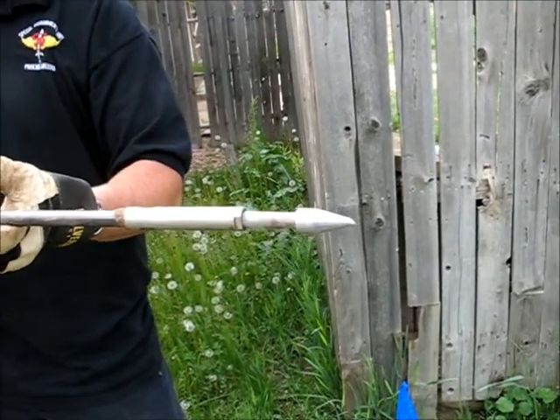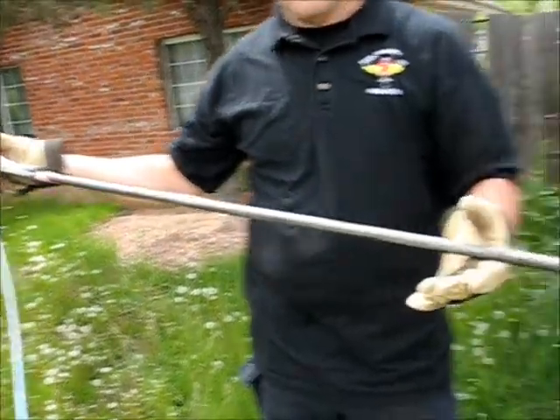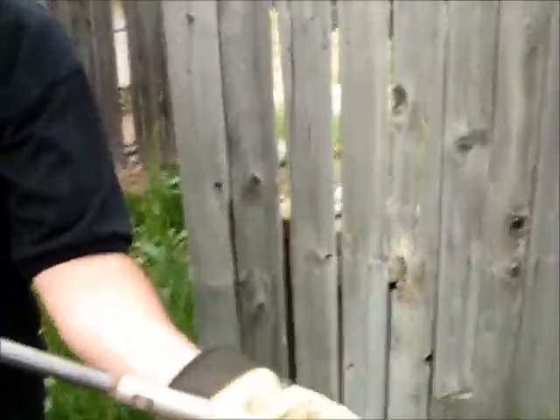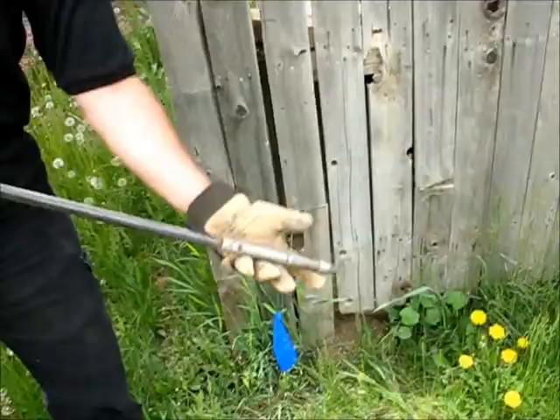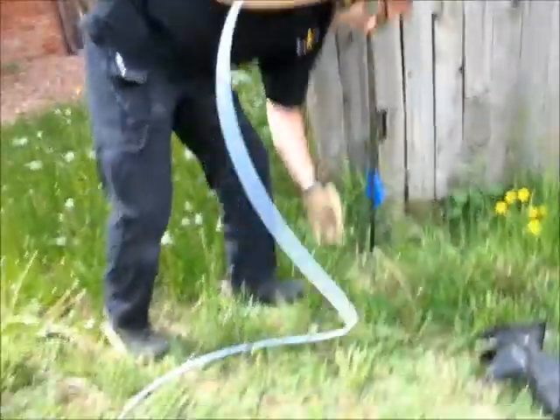We're performing soil gas sampling. What we've got is a soil probe, and this is driven into the ground by hand. There's a retractable tip. The retractable tip is driven in, and then the operator pulls it up a little bit, exposing that screen. We draw gas up through the line and it goes to a direct reading instrument.